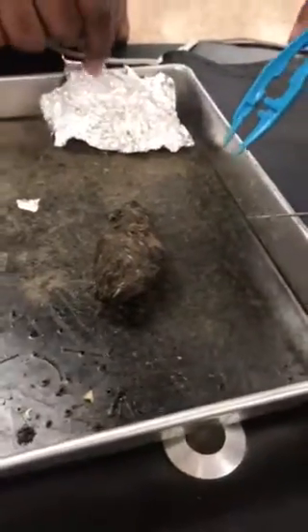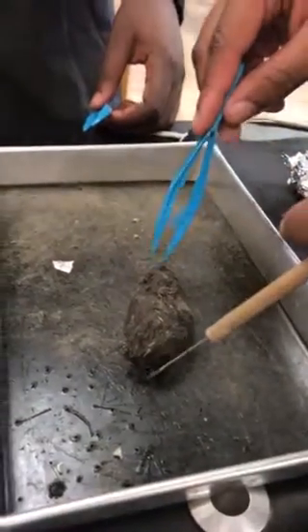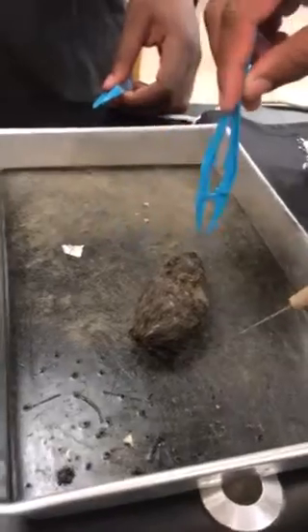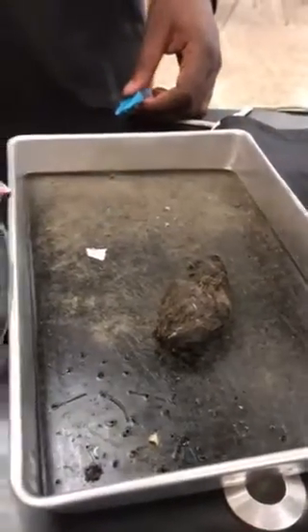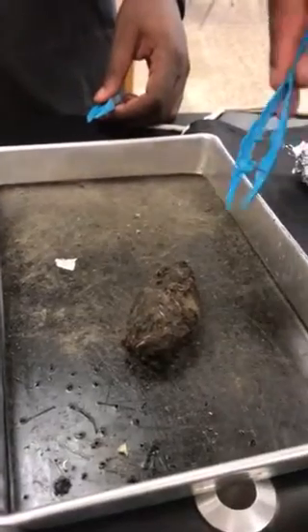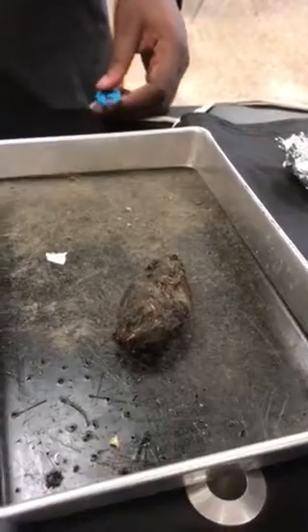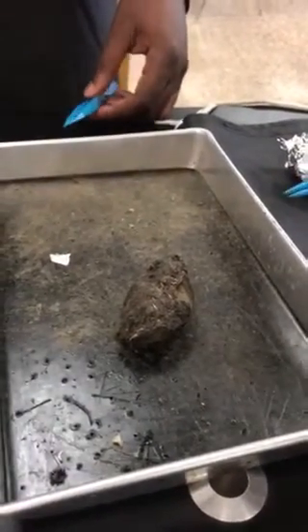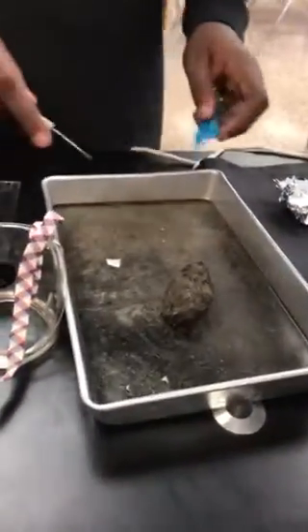Now, what do you know about pyramids and food chains so far as the owl pellet is concerned? It shows the flow, like the placement of the owl in the food chain. Good. And what their feeding habits are, right? So now we can start making some determination about how long they lived, why they died, and we can do all types of studies, right? Cool. Go ahead, do your thing.